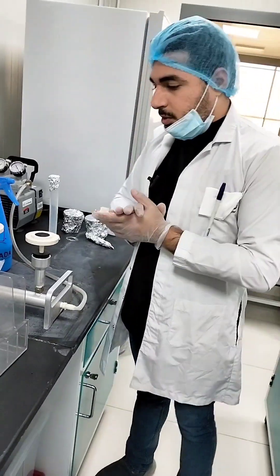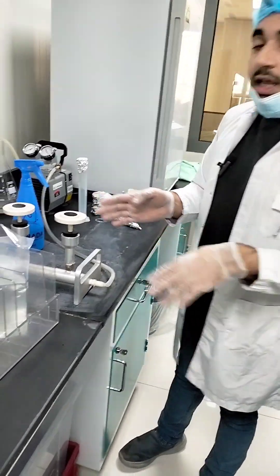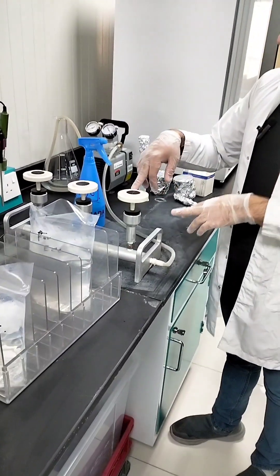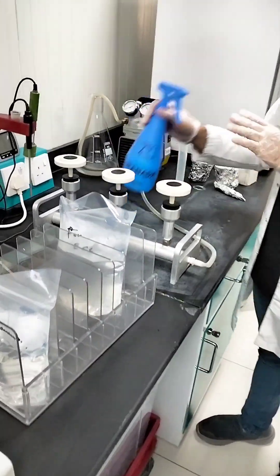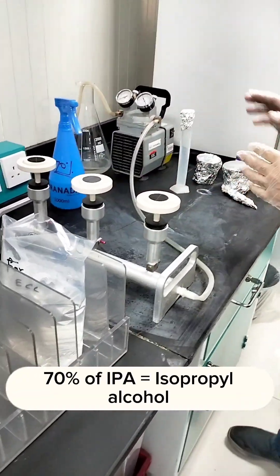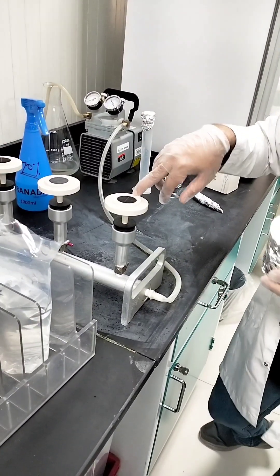Let's start our process. Before starting, make sure you are doing everything very hygienically and under aseptic conditions. The filtrate part of the filtration assembly should be disinfected with 70% IPA, as should other apparatus like measuring cylinders and the funnel part of the membrane filtration assembly.